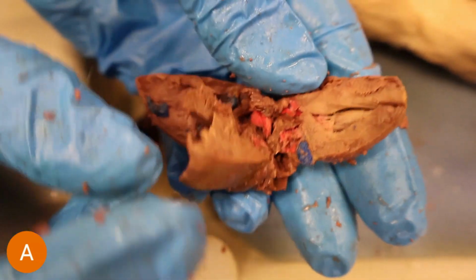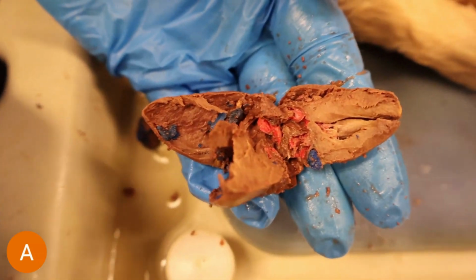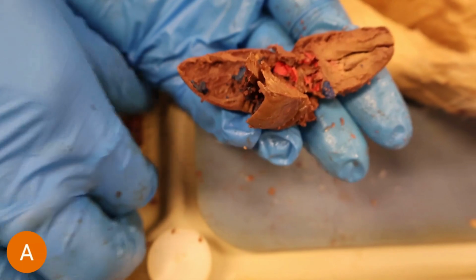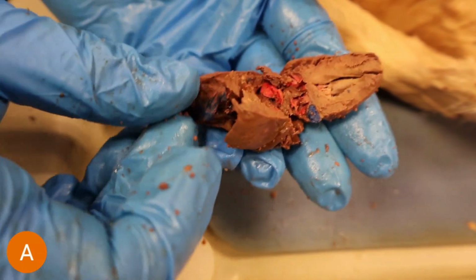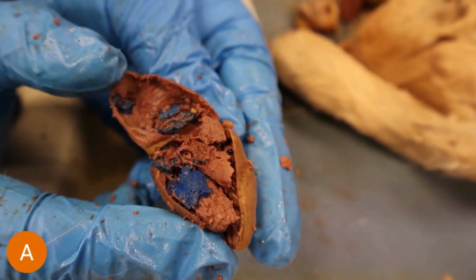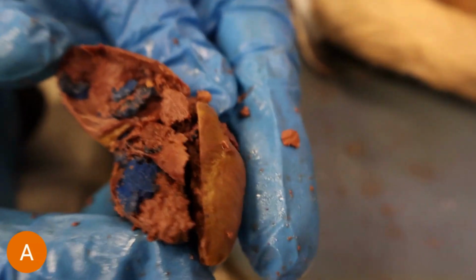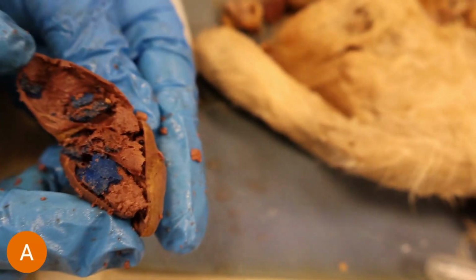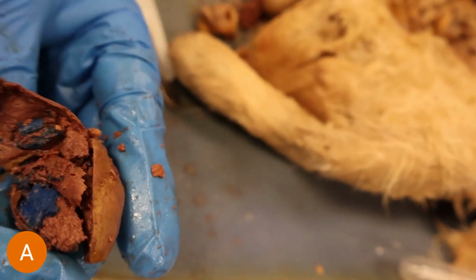The heart is located underneath the lungs. You can see where the lungs are located underneath the rib cage and the diaphragm, and underneath all of those is where the heart is located. The heart definitely supports the muscular structure of mammals, being able to pump blood as well as oxygen to the different limbs and appendages more effectively.